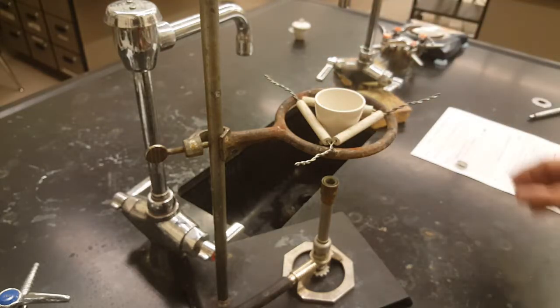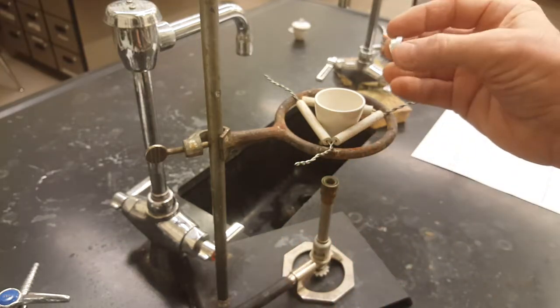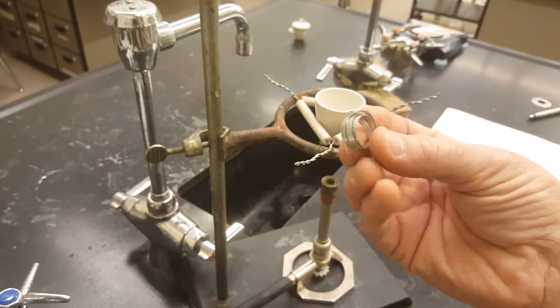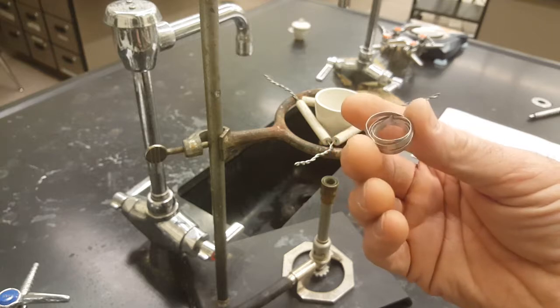When I say reaction mixture, I mean the magnesium and the oxygen in the air. And by raising it to its activation energy, we should see a synthesis reaction between the magnesium and the oxygen. At this point in your notes, go ahead and write that synthesis reaction down.